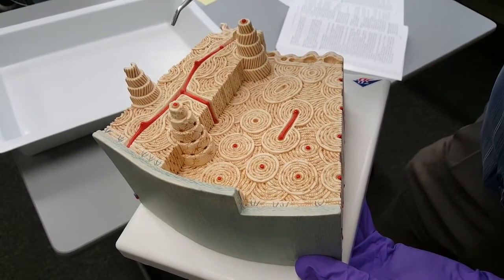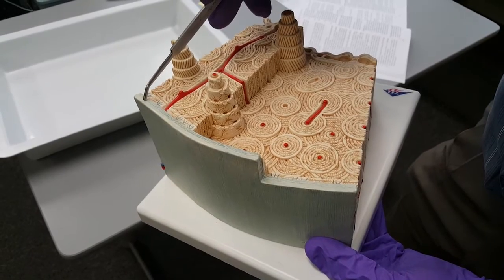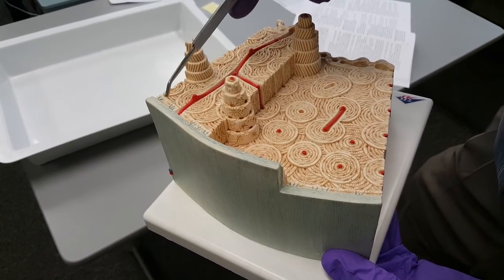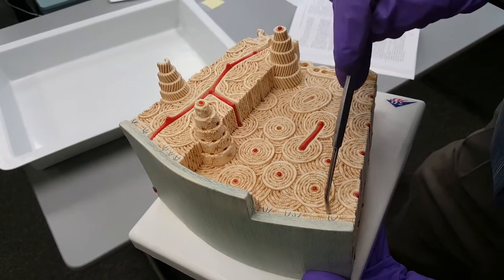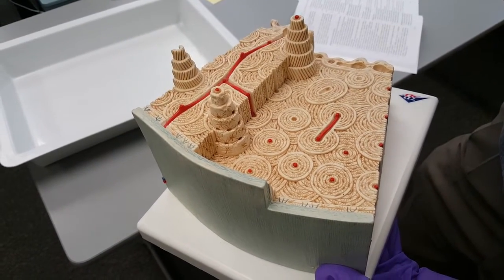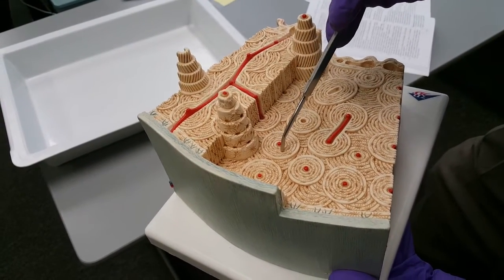Now, around the circumference of the bone, we have this tough layer of connective tissue called the periosteum. You can see it here. Under the periosteum, we have these lamellae, but they're not concentric. They are running around the circumference of the shaft of the bone, and they're called circumferential lamellae, to be distinguished from the concentric lamellae, which are found in the osteons.